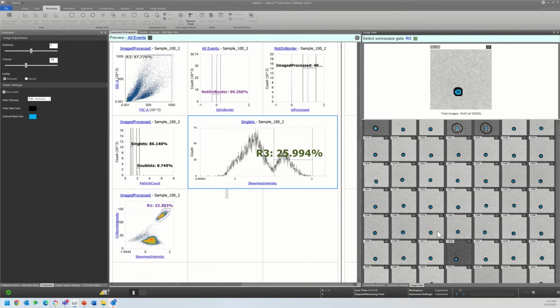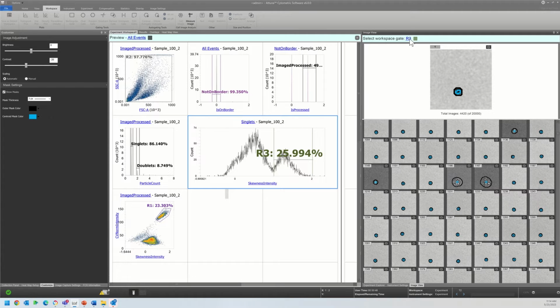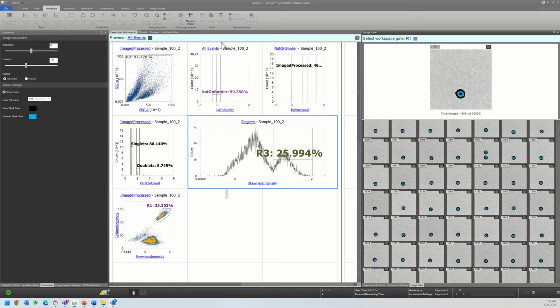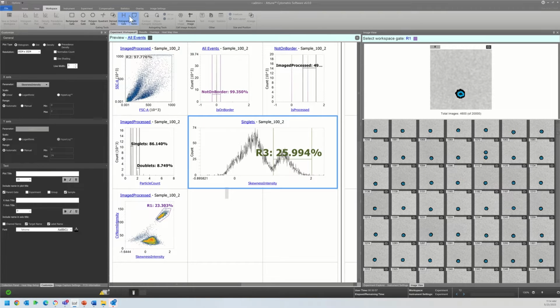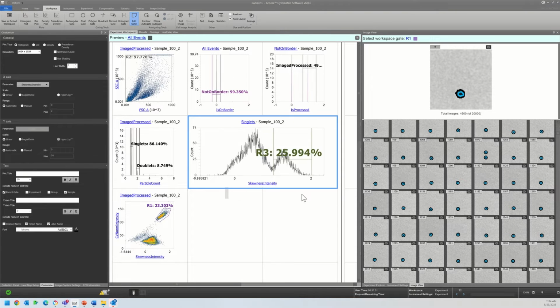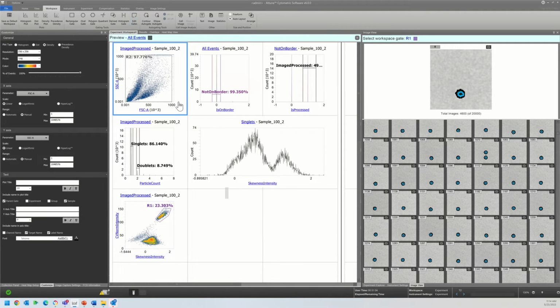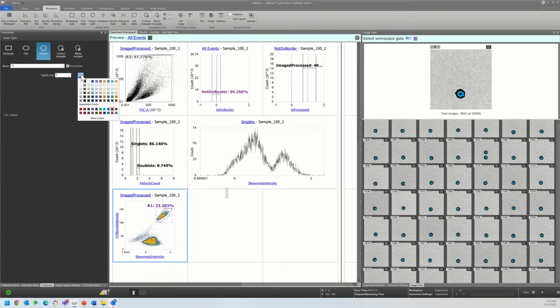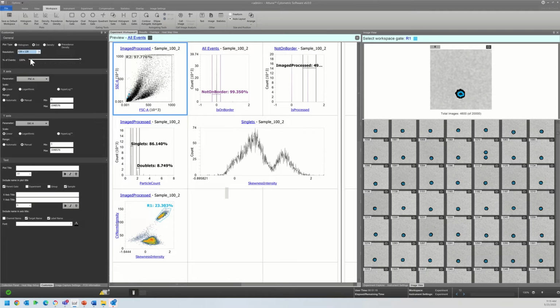And there we have it. These are mostly beads. And let's look at R1. Those are mostly our bead populations. And so this is one of the ways that I would begin to potentially backgate onto this plot. So you see I'm taking this plot, turning it into a dot plot. And I am going to make this much brighter. It's the resolution. And you can see here, this is my bead population during acquisition.